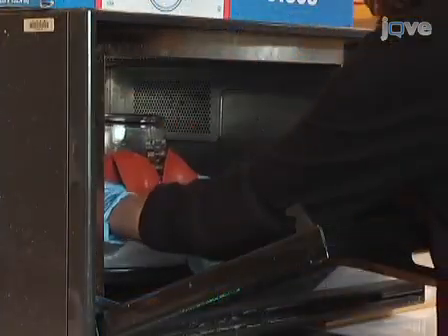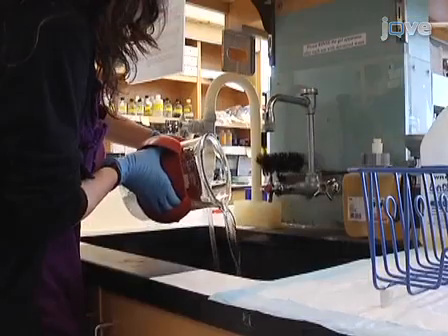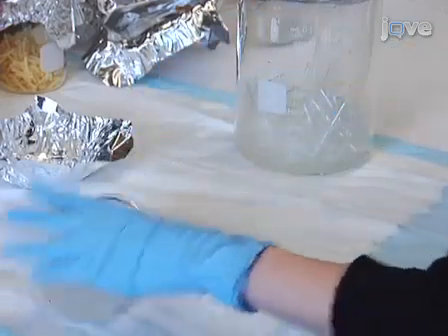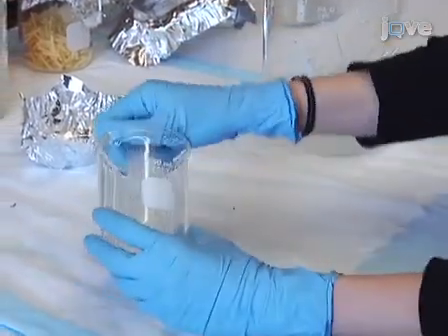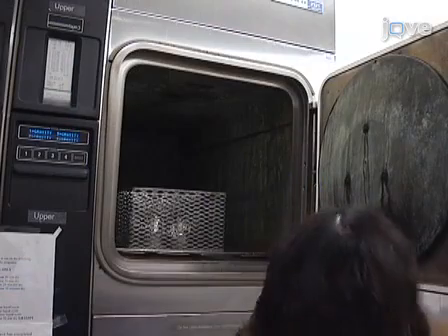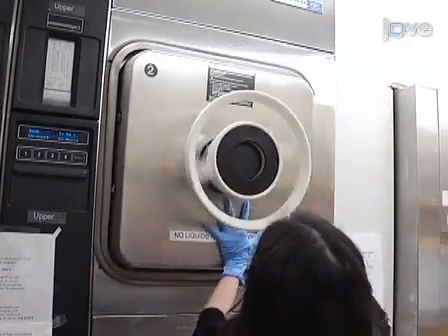Repeat the microwaving process for the last time. Pour the water out of the beaker and wait for the activity tubes to cool down. Next, load the activity tubes vertically into 250ml or 500ml glass beakers. Make sure they are not too tightly packed. Sterilize them by using an autoclave with a dry cycle or simply dry the tubes in a drying oven.